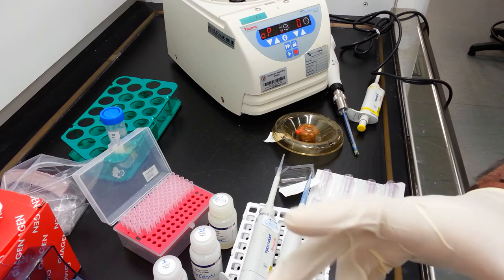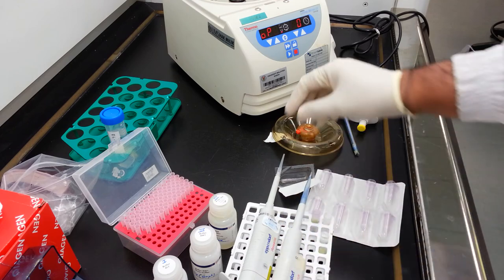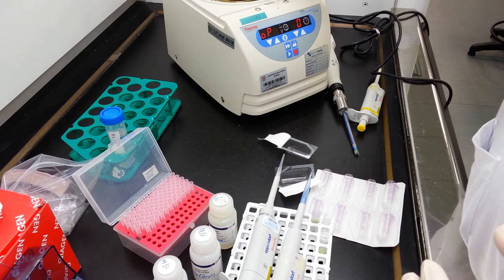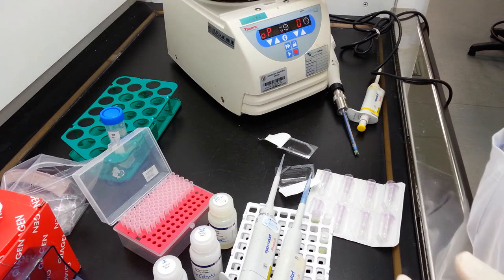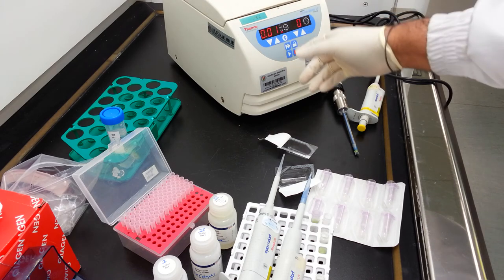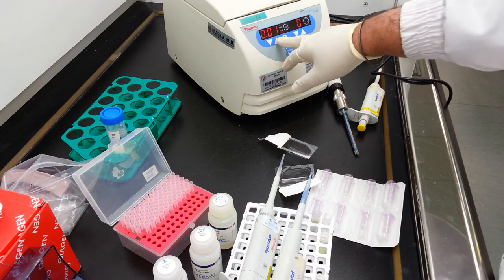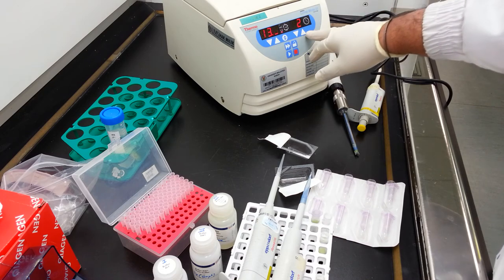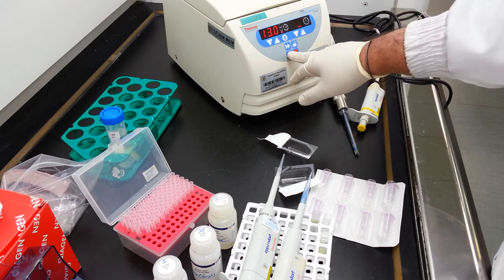After hydration of the membrane, you need to maintain a hydrated state for 2 minutes. After 2 minutes of hydration, or what is referred to as incubation, you may spin down the tube for 1 minute at 13,000 G.